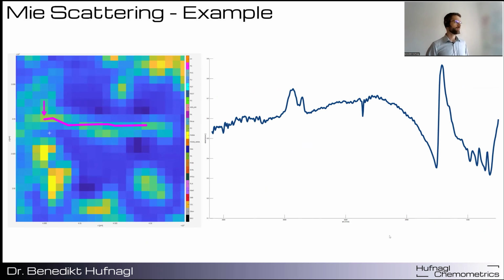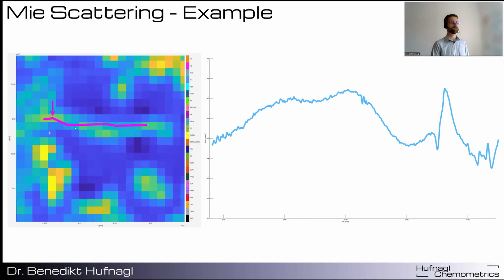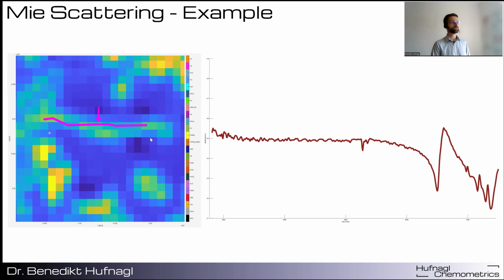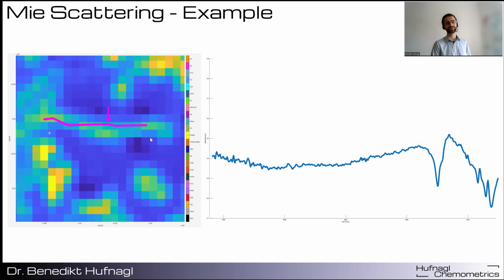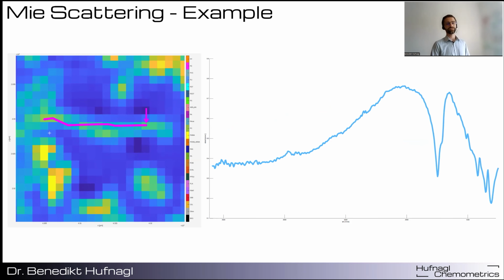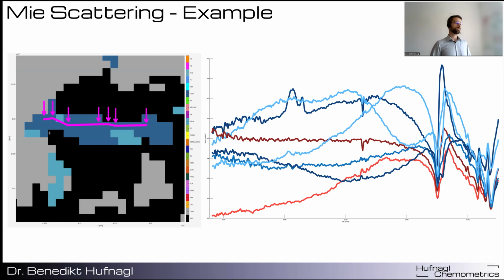And now let's have a look at the practical example again. Here you can see a polyester fiber from an environmental sample. You see these typical prominent peaks of polyester. And now let's see what happens if we again sample across this fiber. Here we can already see a strange change in the spectral signature. And now it gets even worse. The peak gets this very prominent S-shaped curve. And then it actually inverts. So the peak is completely lost. It disappears and turns to the other side. And here it's even worse. Now you can see all these spectra superimposed. But if we train our machine learning models well, we are still able to detect these fibers completely.